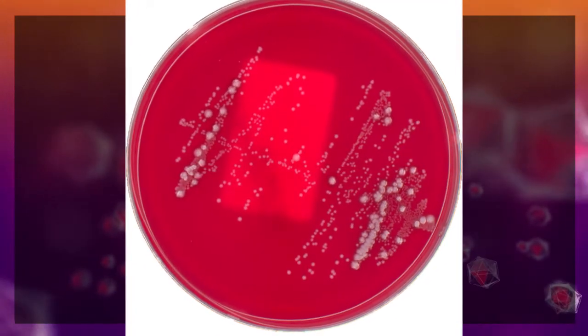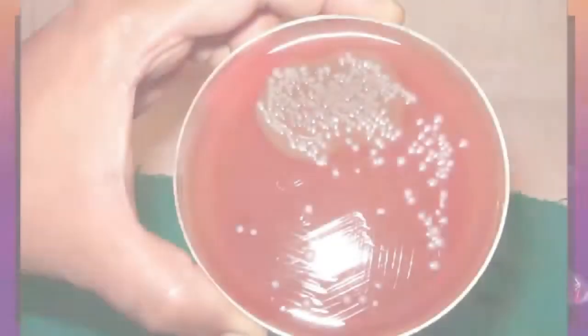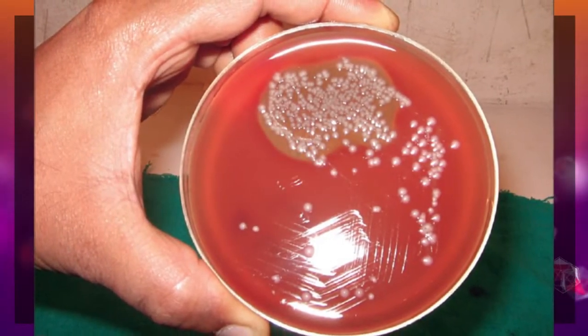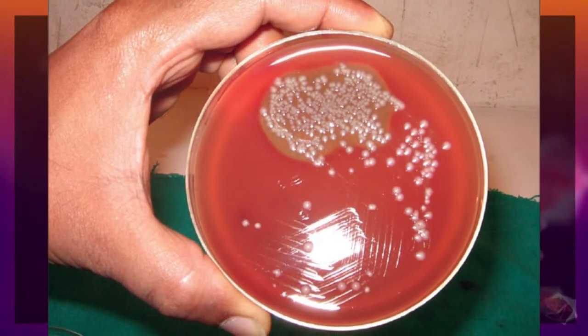To avoid false positives, select colonies of different morphology that are separated by at least 5 mm for indole testing.